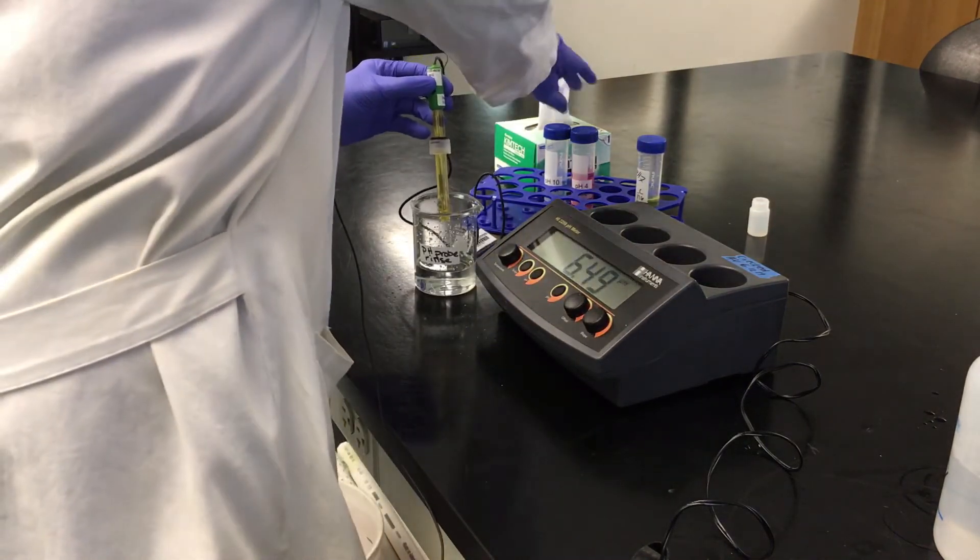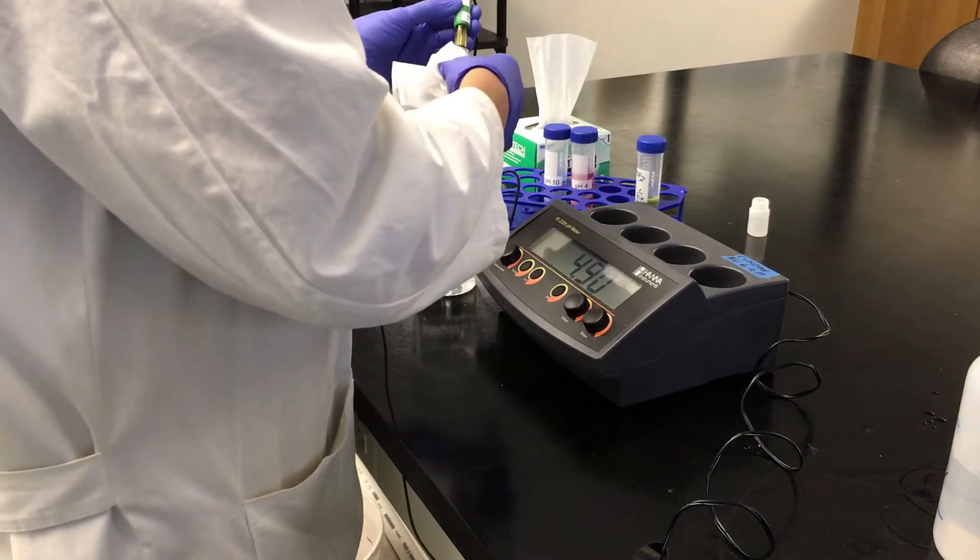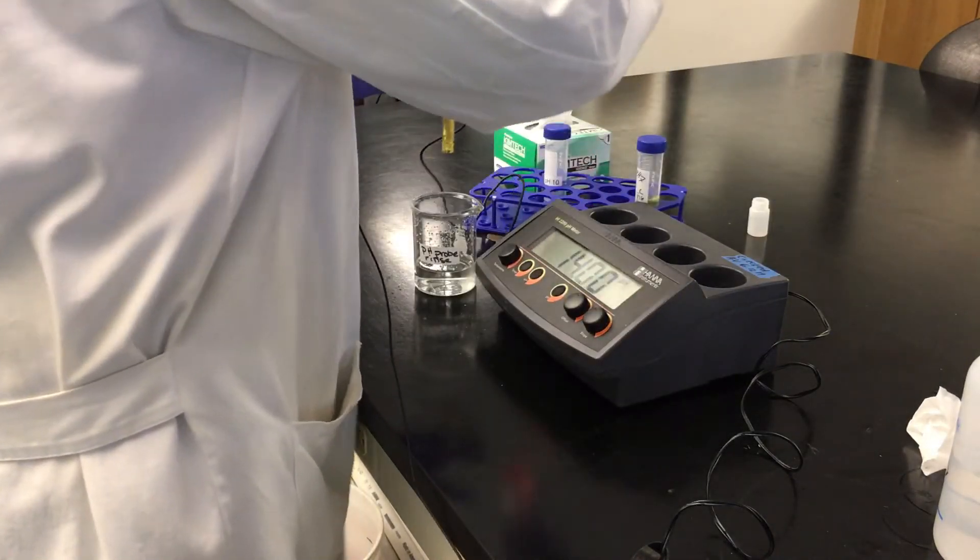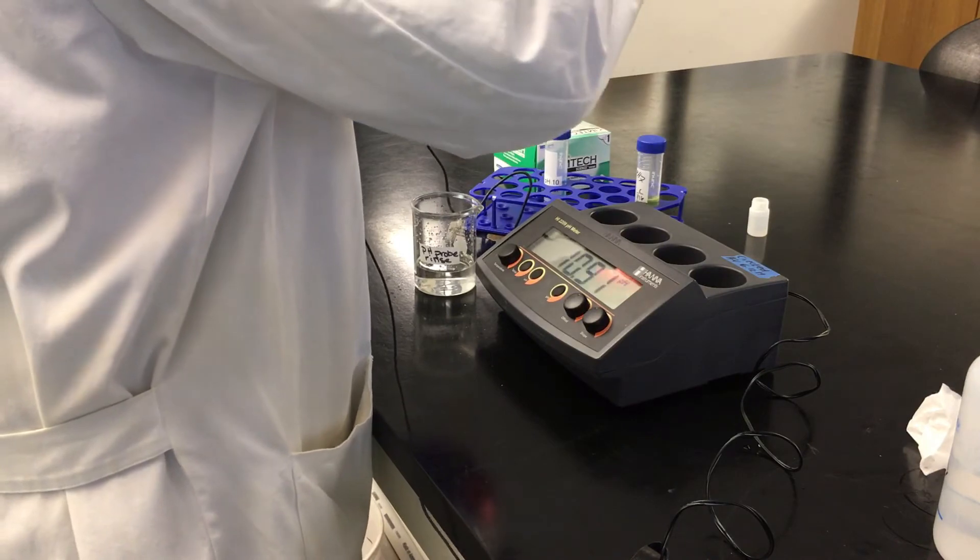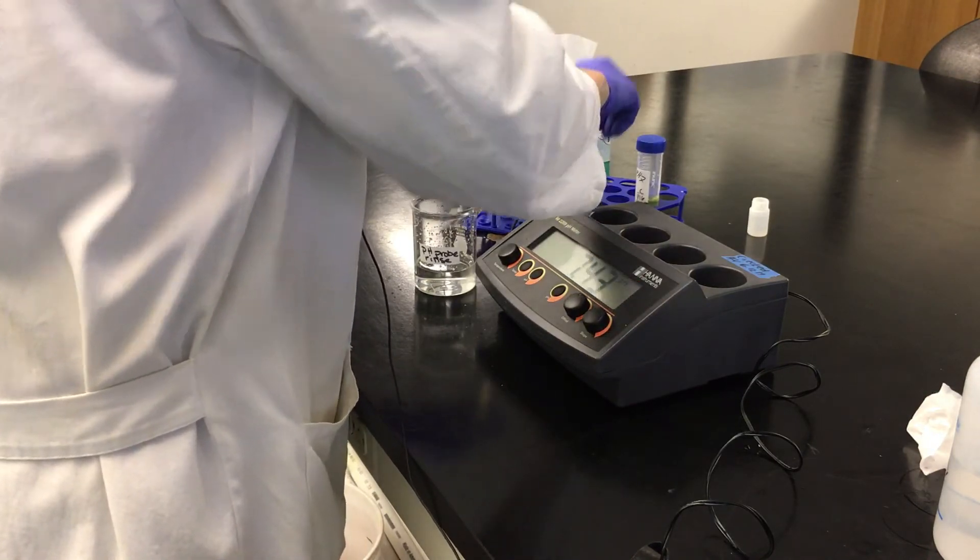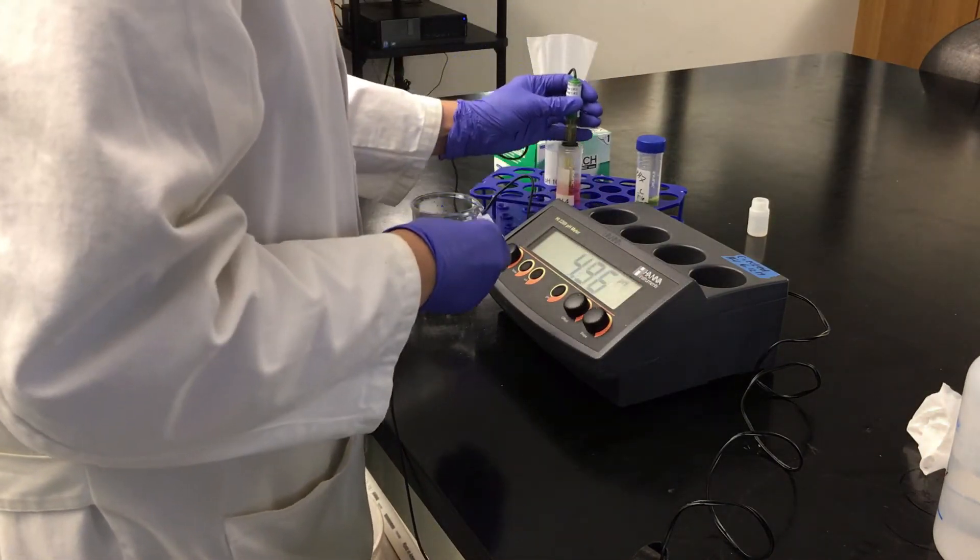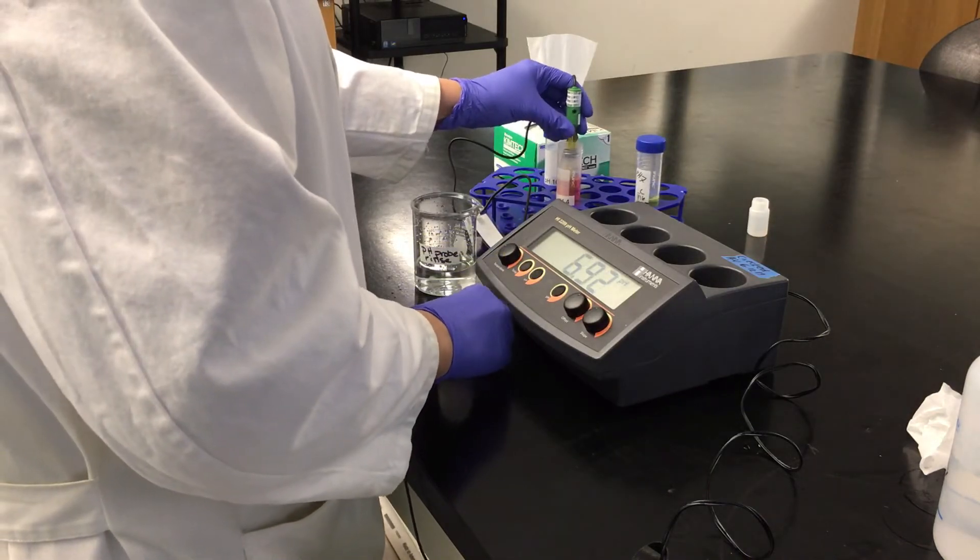So again, I'm going to dab, and then I'm going to stick my probe into pH 4 solution.